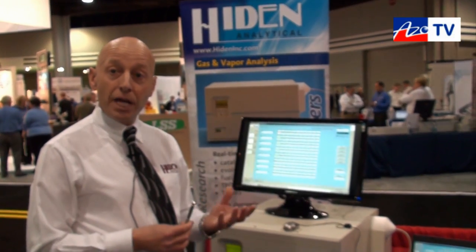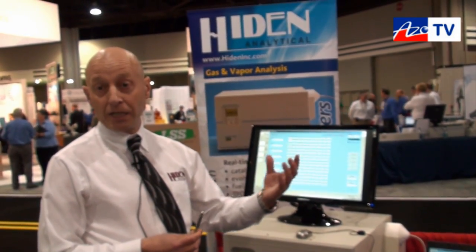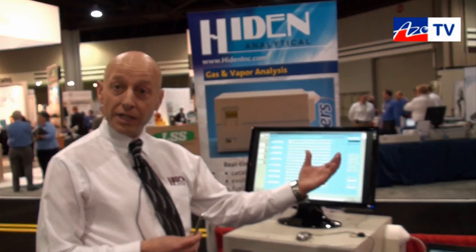For folks looking to do multi-stream gas analysis, we also have a range of multi-stream inlets from 8 streams all the way up to 80 streams. We can bring in many process gas lines, gas sampling lines, along with calibration gases, purge gases, and zero gases, so we can perform accurate quantitative gas analysis.